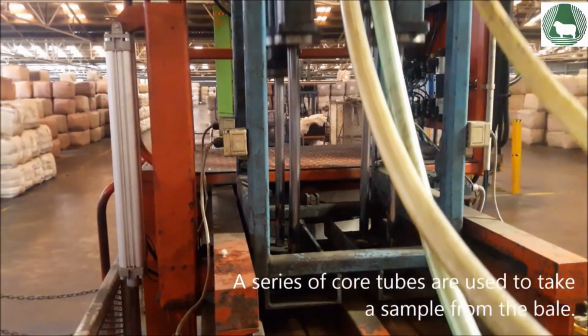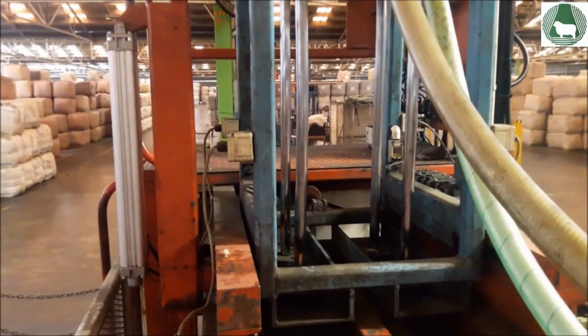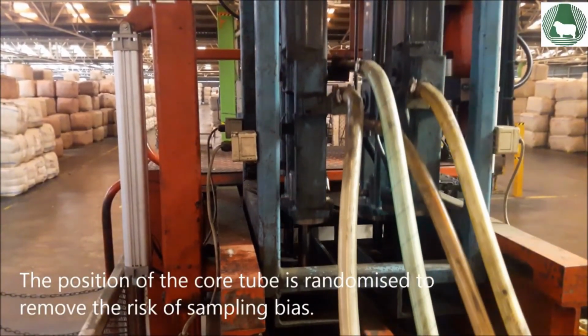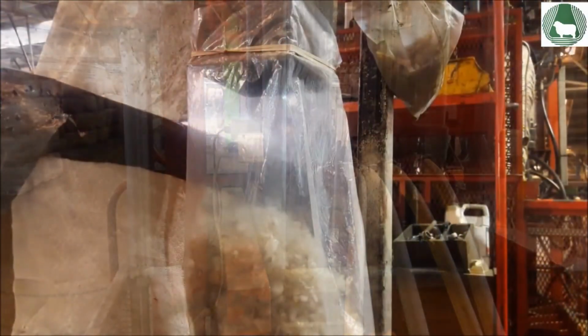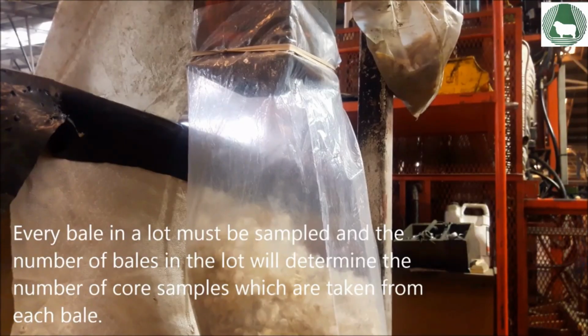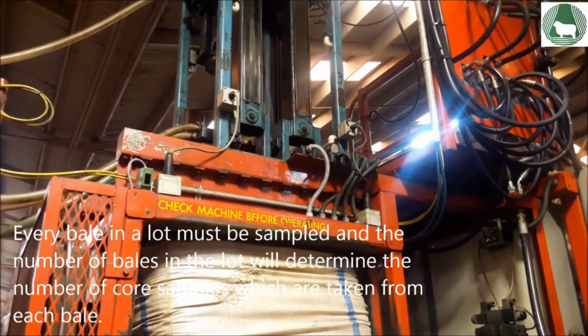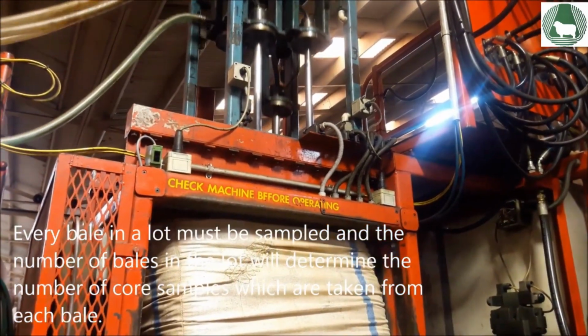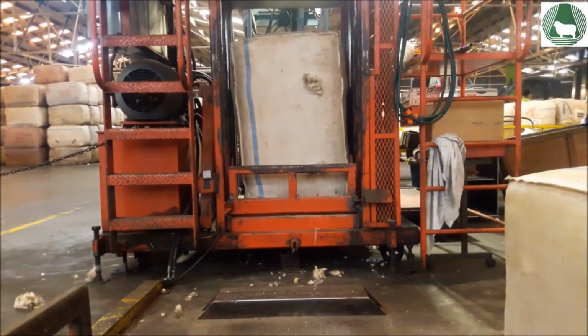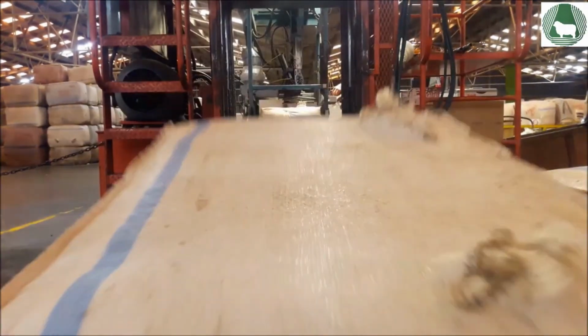For machine sampling, the bales are compressed to half their length and a series of core tubes are used to take a sample from the bale. The position of the core tube is randomized to remove the risk of sampling bias. Every bale in a lot must be sampled, and the number of bales in the lot will determine the number of core samples which are taken from each bale.